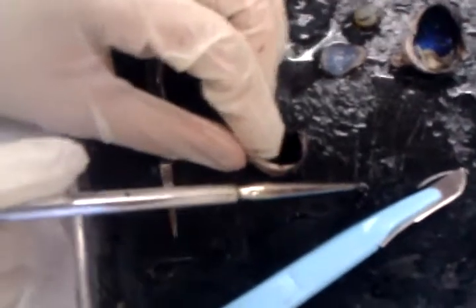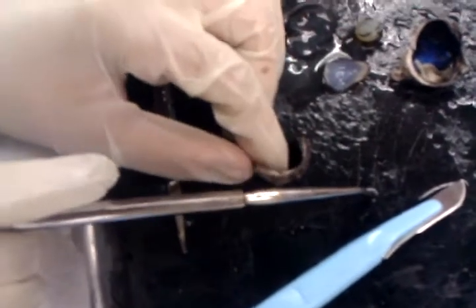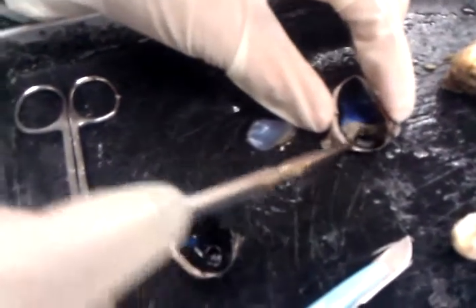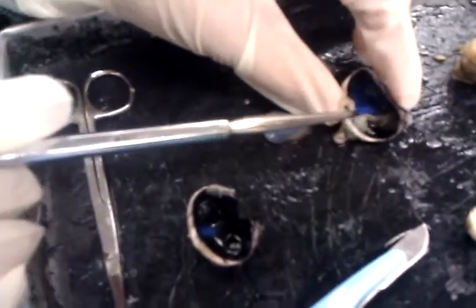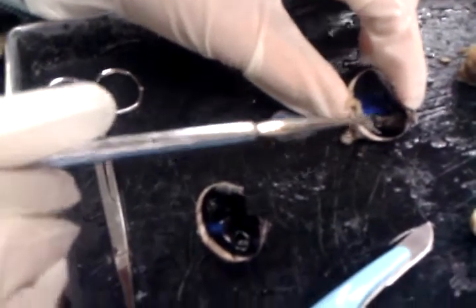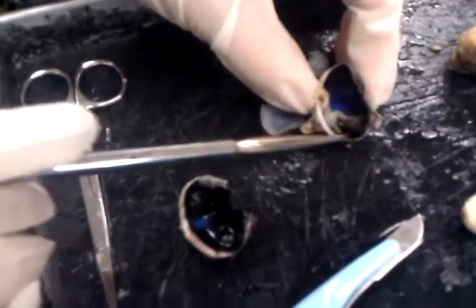And this part right here was the cornea. Retina — retina is this little membrane right here, this membrane. The choroid is the black part right here.